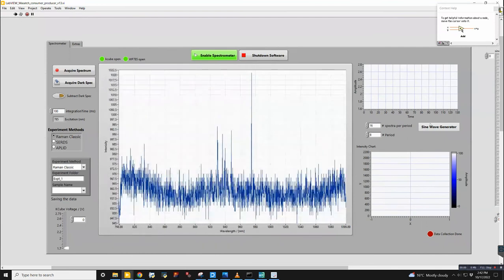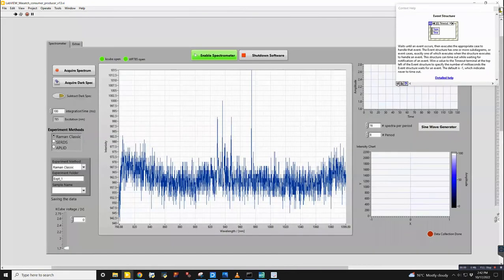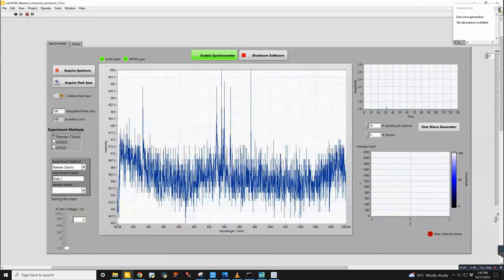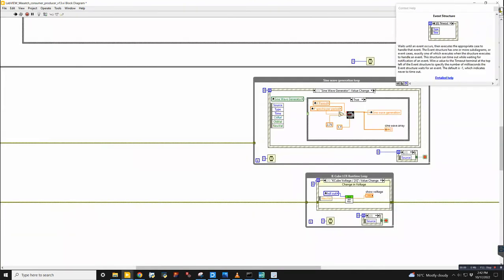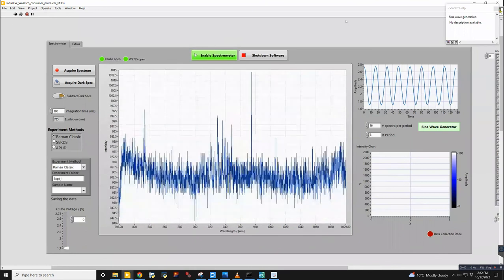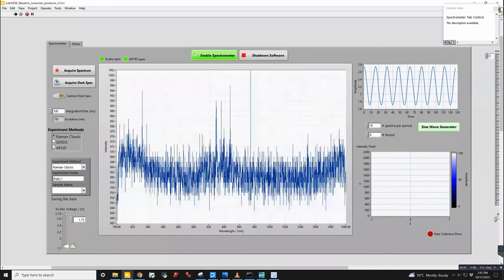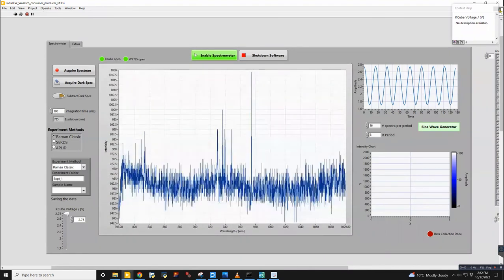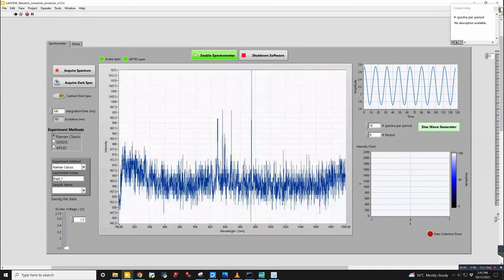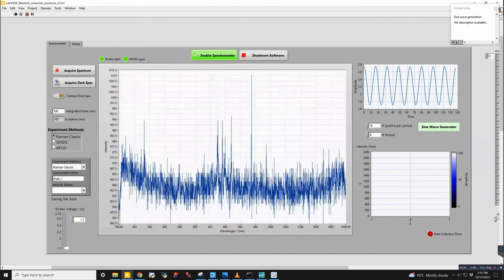Sweet. Okay, so basically we have this sine curve generator loop, and it's treating this sine curve as an independent function, like a function generator, but all of it is just internal software. It's just waiting for you to click go. So when you click sine wave generator, it will produce a sine curve there, and it will use that for modulating the voltage. The minimum and maximum voltage is set by default over here. So 2.75 is the maximum voltage for one laser, and 1.7 is for the other. It will modulate between those. We'll take 16 spectra per period. So the peak to peak number of data points is 16, and it repeats that 8 times. And that's pretty much it.